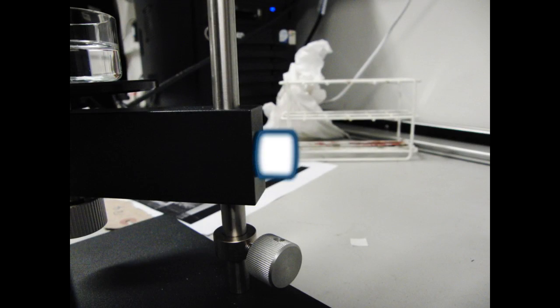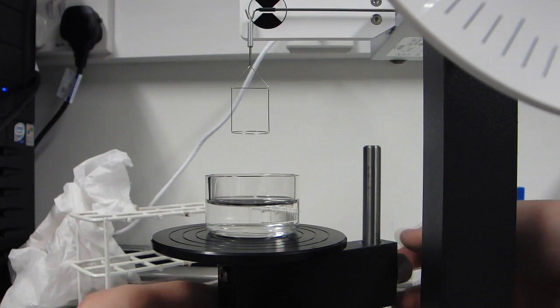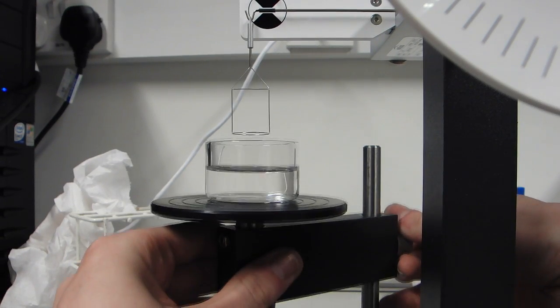The stage is adjusted using this dial at the back. We raise it until the ring makes contact with the sample.